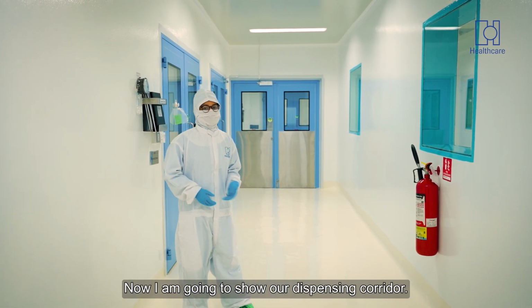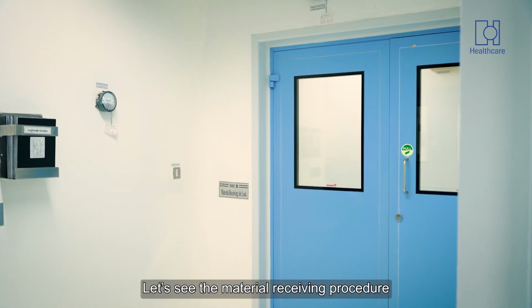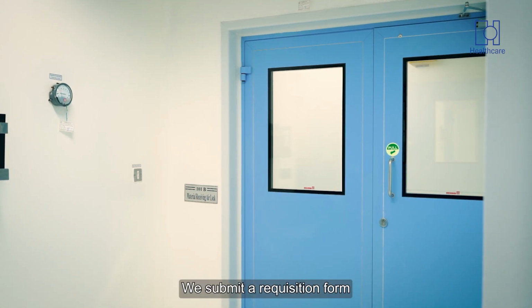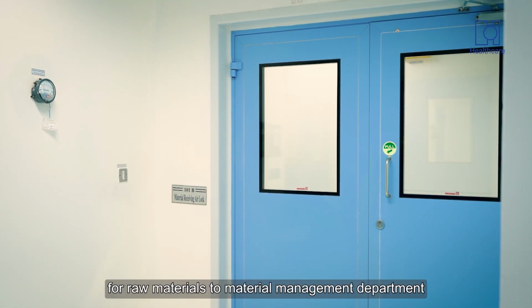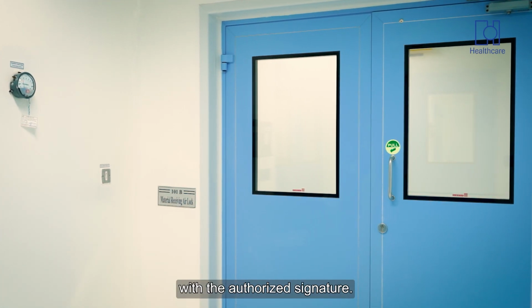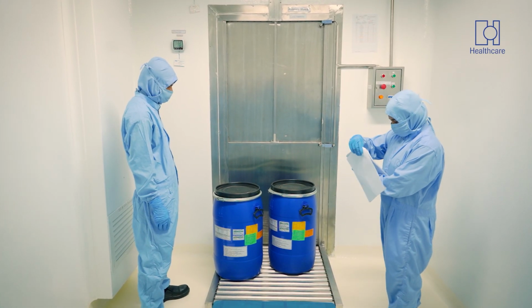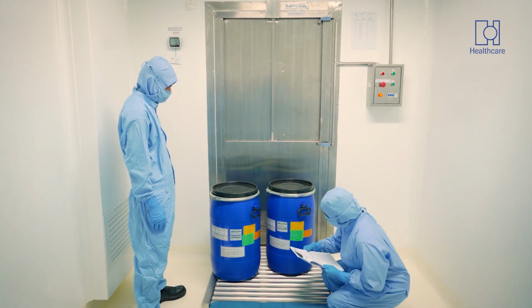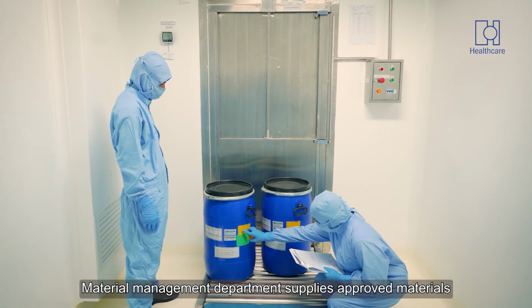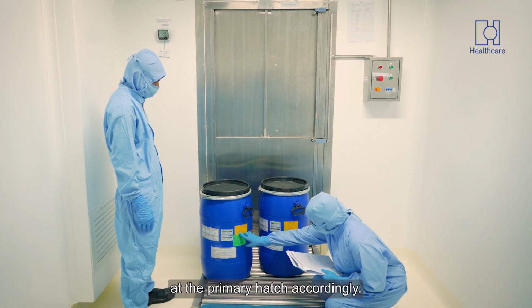Now I am going to show our dispensing corridor. Let's see the material receiving procedure from Material Management Department. We submit a requisition form for raw material to Material Management Department with the authorized signature. Material Management Department supplies approved materials at the primary hatch accordingly.